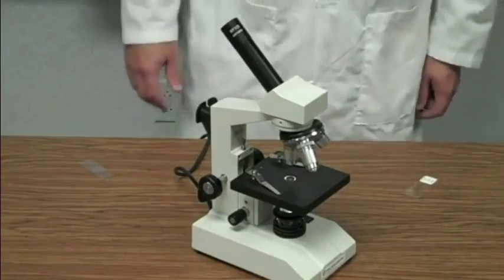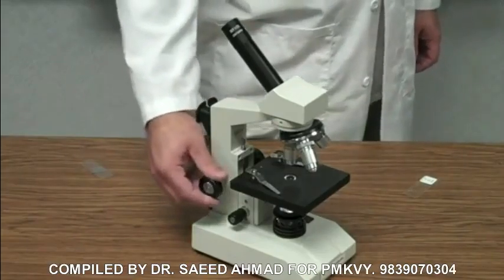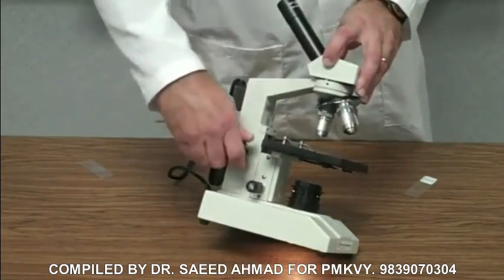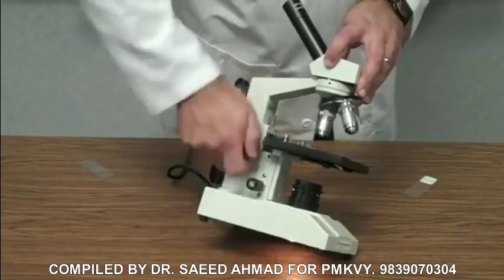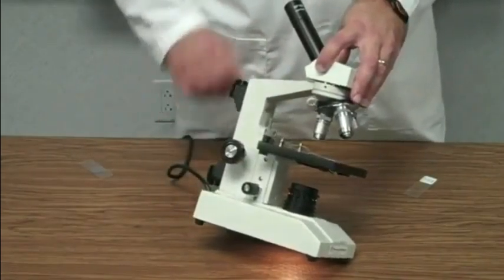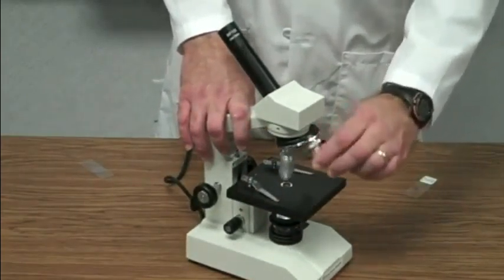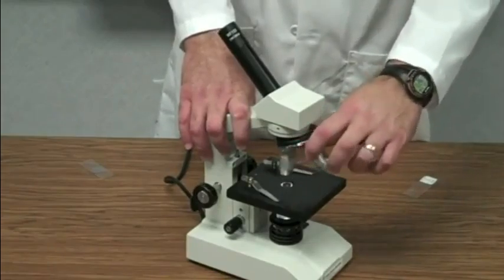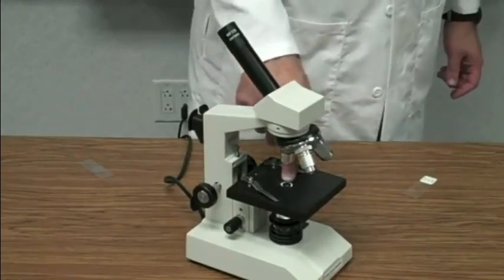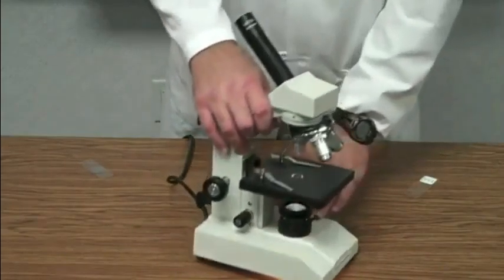So now let's talk about the process, how we go about using the microscope and focusing the microscope and so forth. The first thing is to always make sure that we have the stage as low as it can go. We use the coarse adjustment knob to move the stage all the way down. And you don't have to crank and crank and crank on it. When it stops, it's done. We're going to put the microscope on low power, which is the red band objective. And that objective should be pointing directly straight down over this hole that's in the stage. Then we want to make sure that our light source is on.